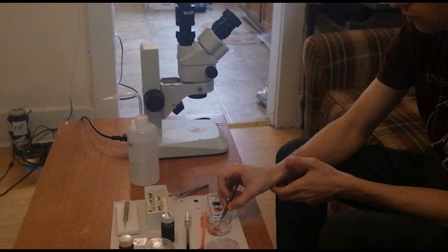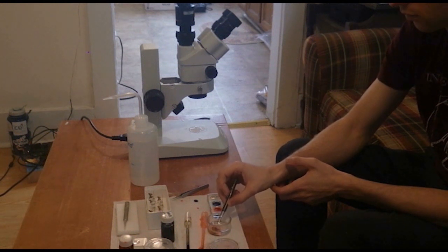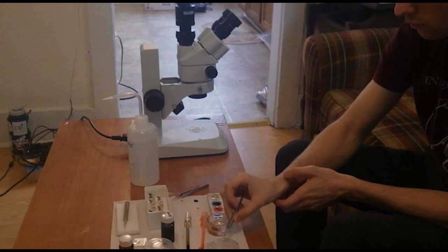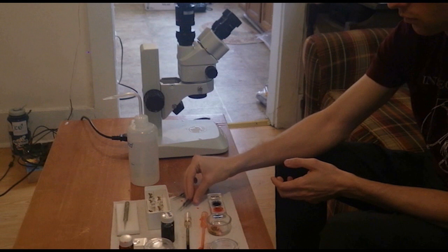Again, I dip them in ethanol to remove any excess stain before transferring them to a watch glass for further cleaning. It's often easiest to wait to separate the genitalia from the abdomen until after staining. I demonstrated how to do this in the previous video.